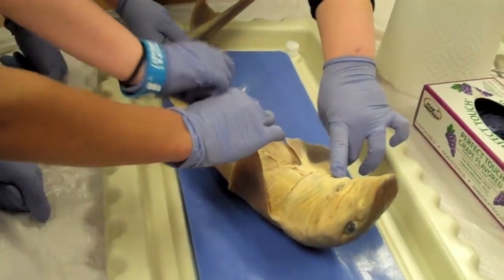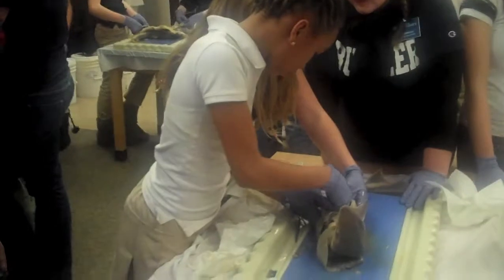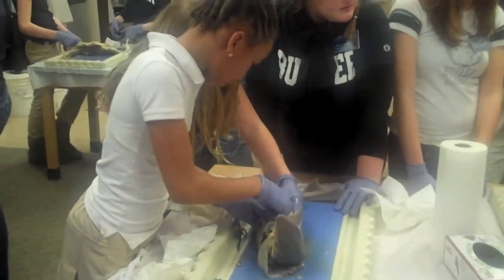Cut through it up. Oh, is that the intestine? Yes. It's almost like it's over here.